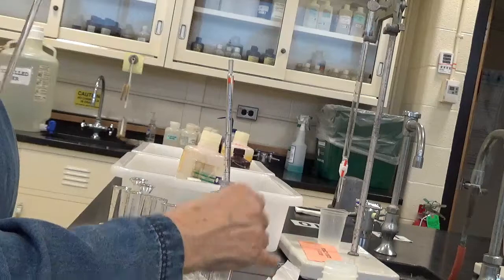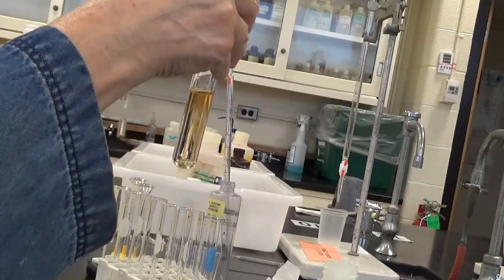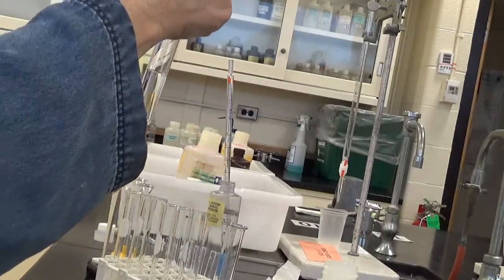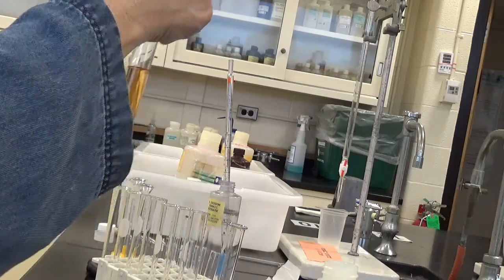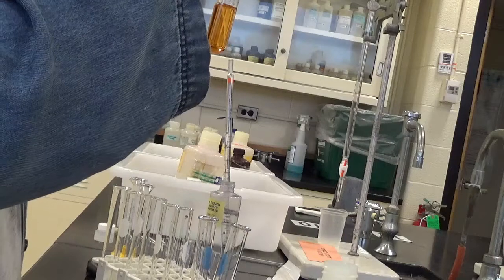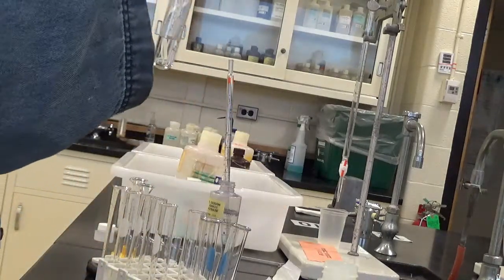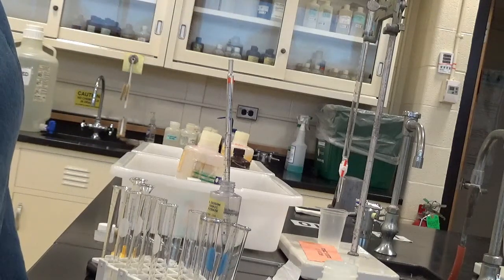Zero. 1 in here. 1. Notice I'm forming complex. 1, 2. 1, 2, 3. 4 on this one. 1, 2, 3, 4.